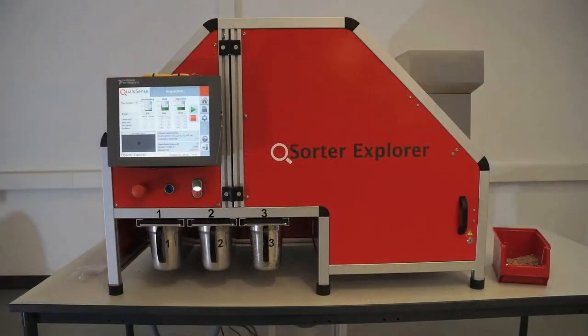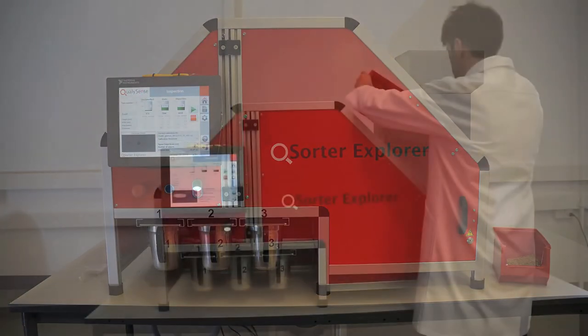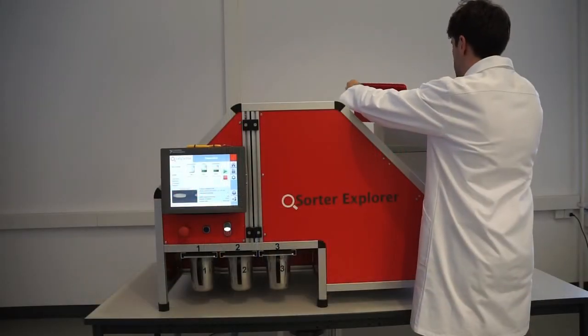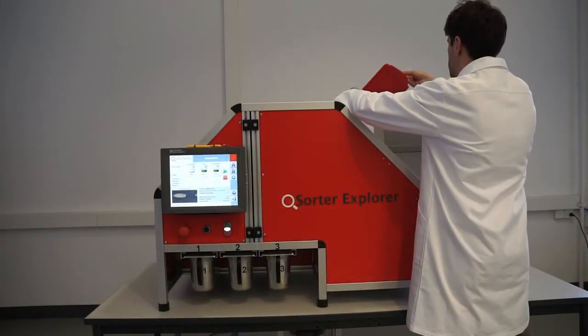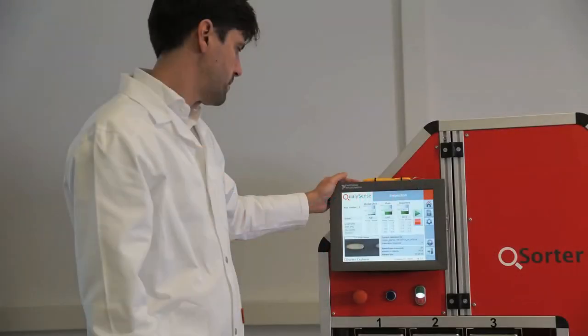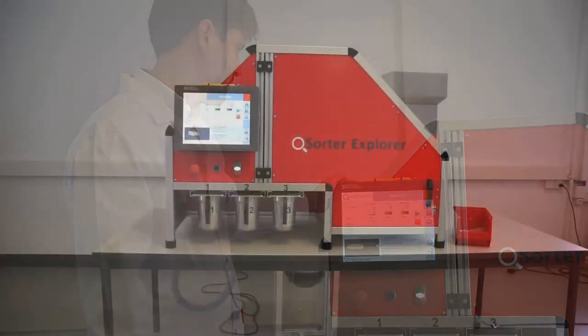One of the most important features of the Q-Sorter Explorer is that it is simple to use. Simply load the sample into the hopper, press the button, and automated analysis begins.